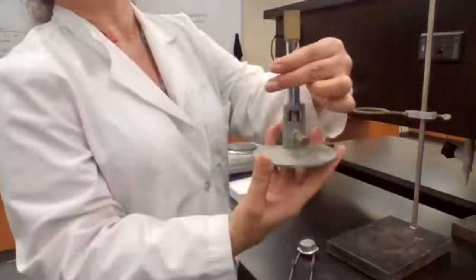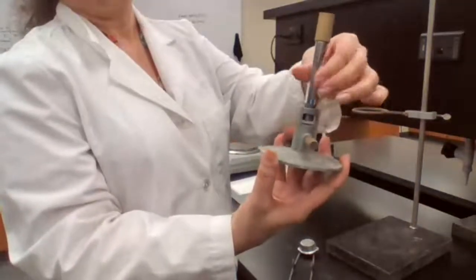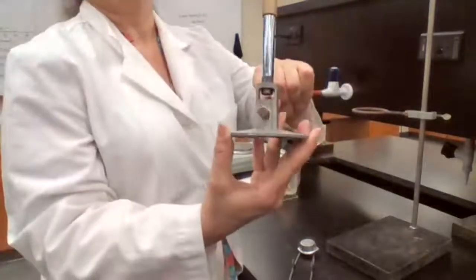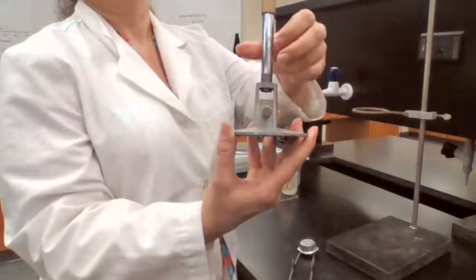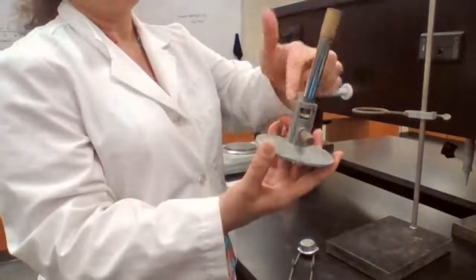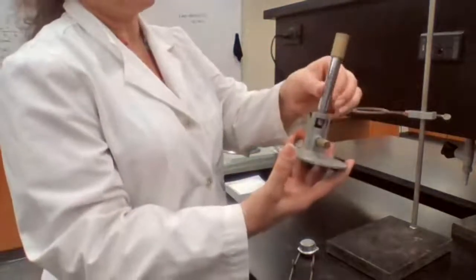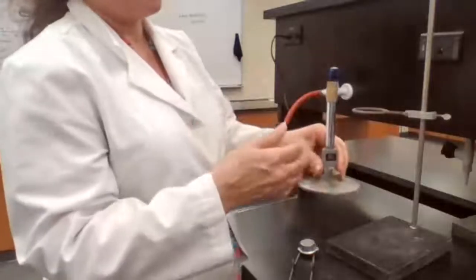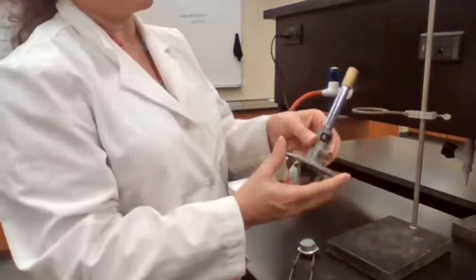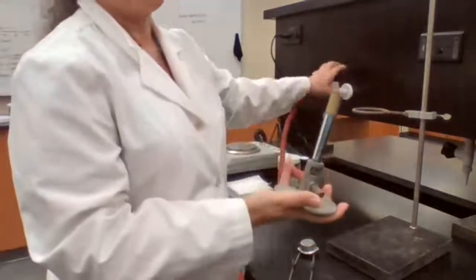By moving the cylinder, you have to hold on to the cylinder in order to again righty-tighty, lefty-loosey to the left side, and you are going to see this opening here. It gets increased, more air is going to come through. What is the benefit of adjusting this? Then you are going to get the proper ratio of gas and oxygen, so the natural gas, which is the organic compound, and then the oxygen. The oxygen is provided from the air. The gas is coming from the gas valve here.